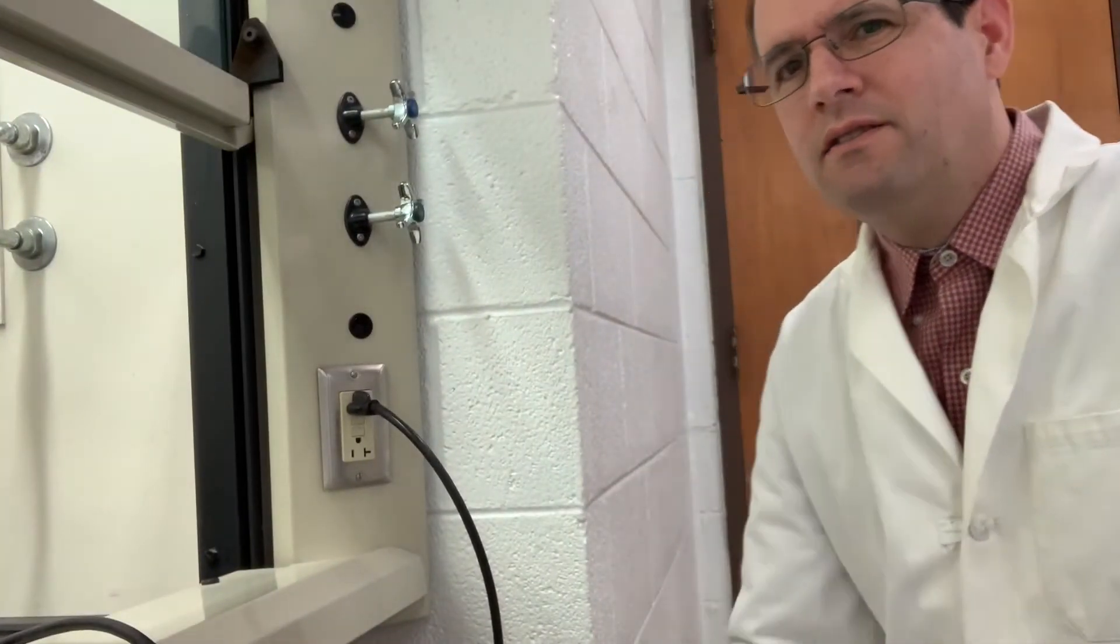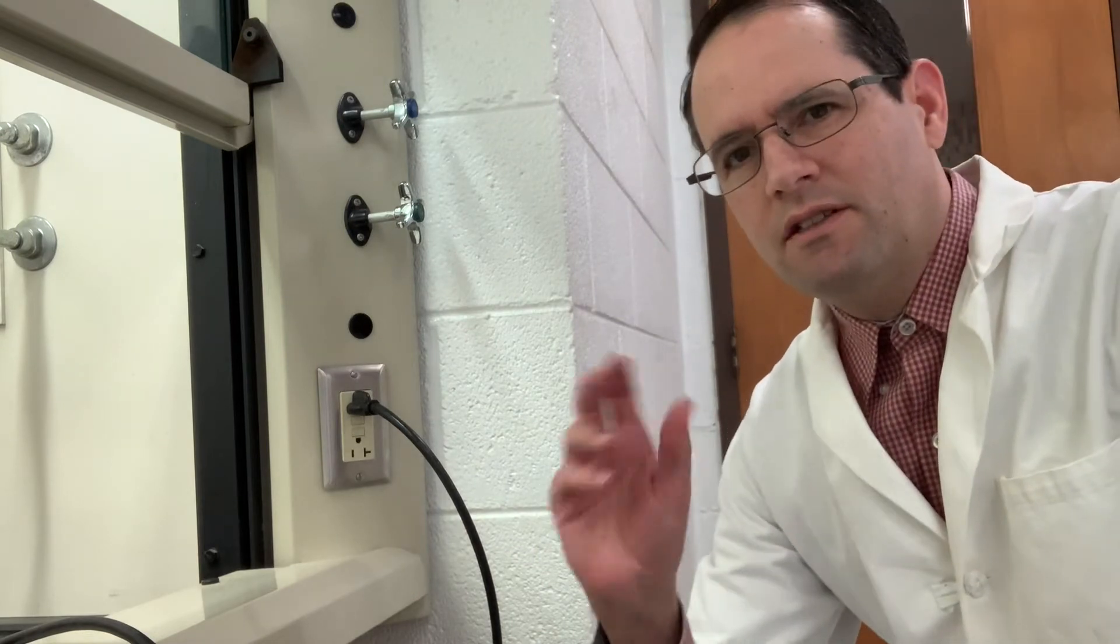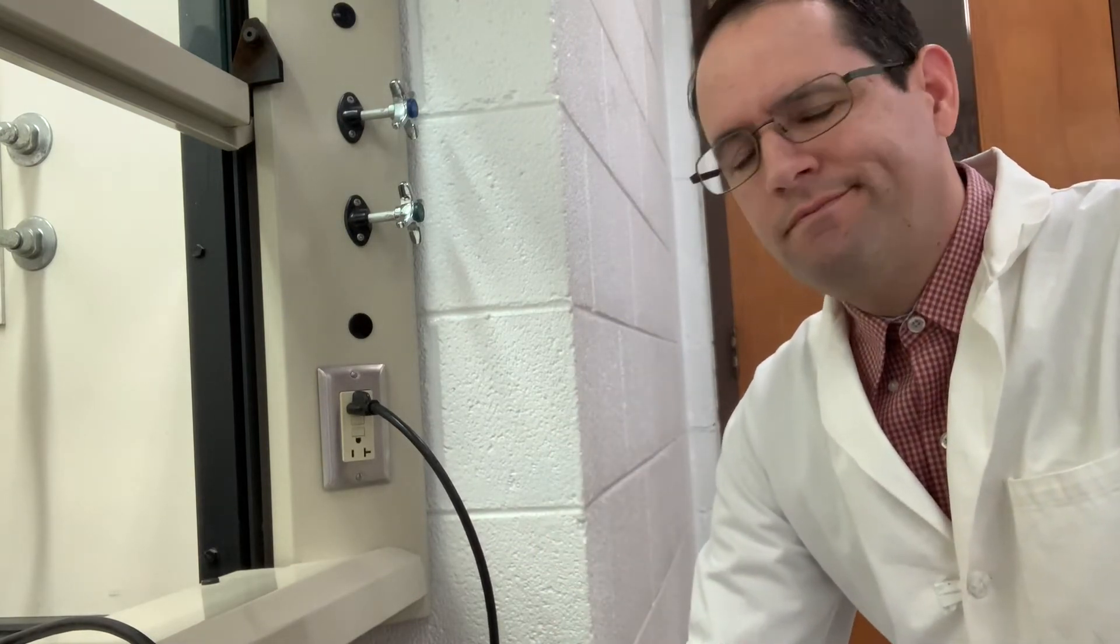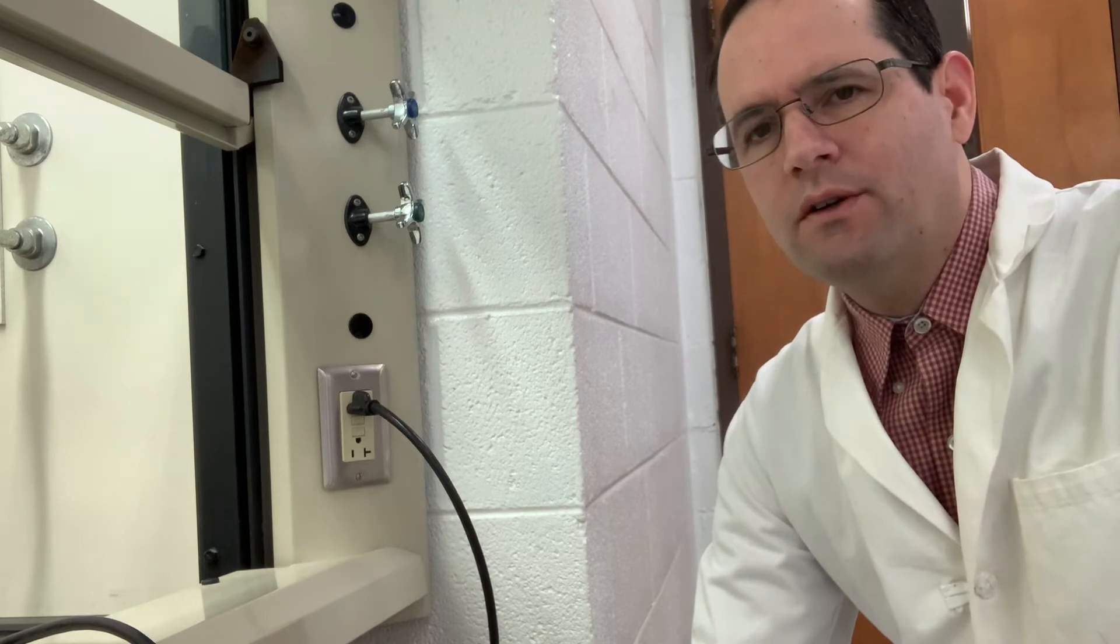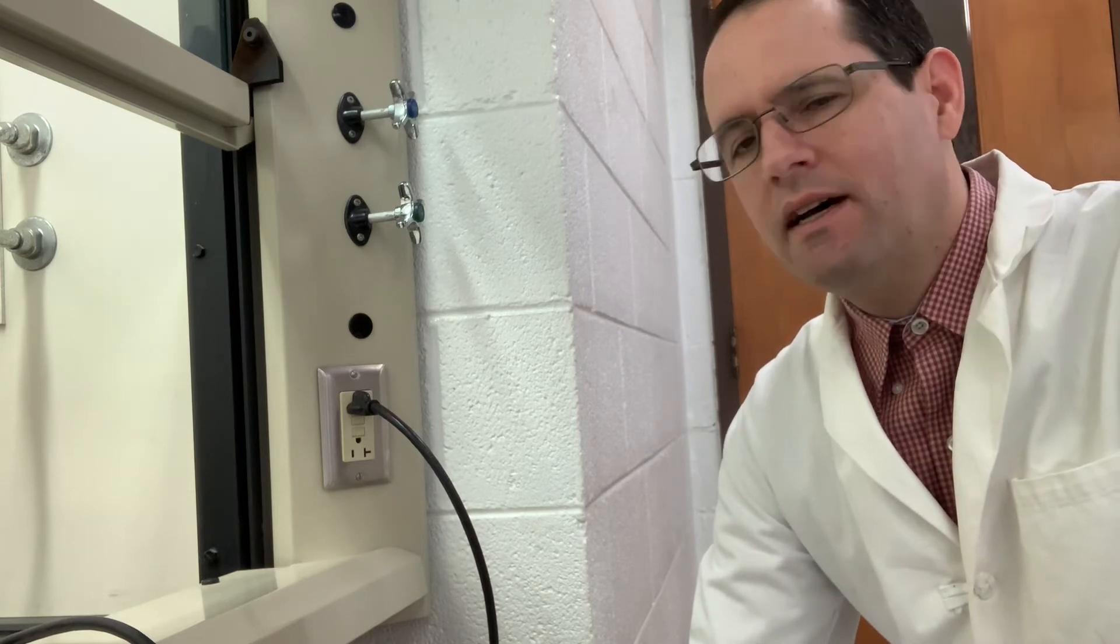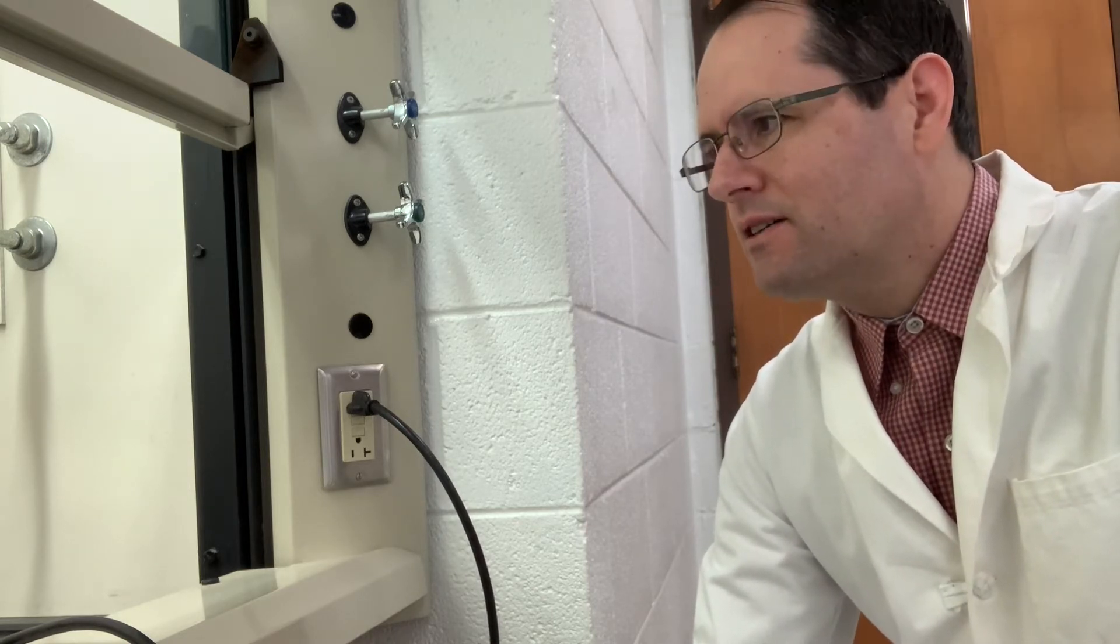That's what the reaction is going to look like for the next hour - a gentle simmer progressing through a darker color as I recall. I'll stop the video now and take you back an hour from now to show you what it looks like right before I stop the heater and proceed with the isolation.